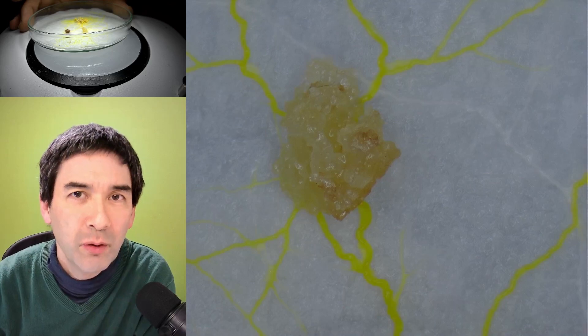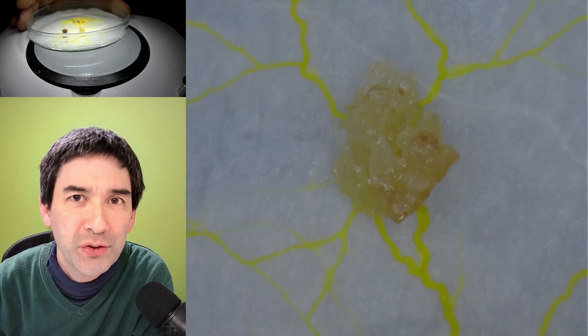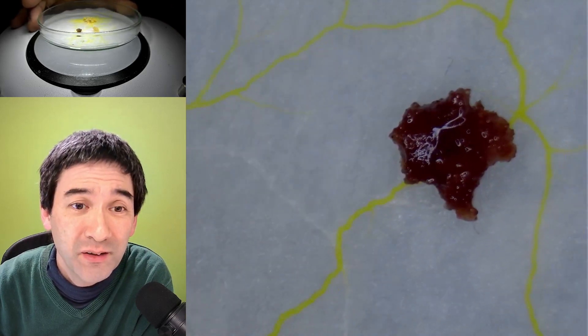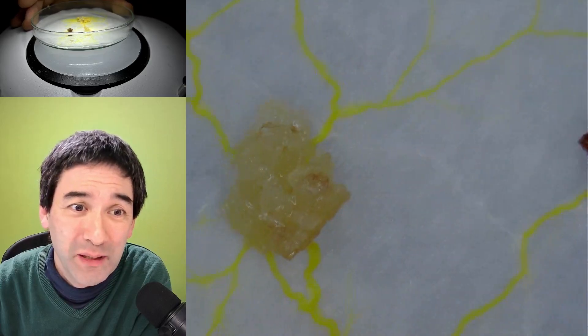What we expect now over the next couple of hours is that the slime mold will start to devour the two cookies here. That's the chocolate one. We're just going to wait a little bit. So now to the compound microscope.